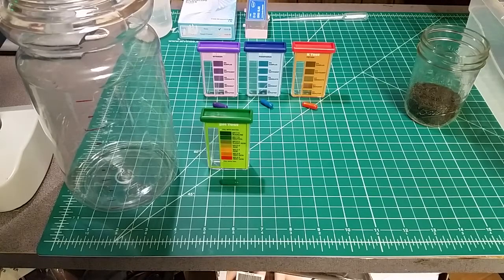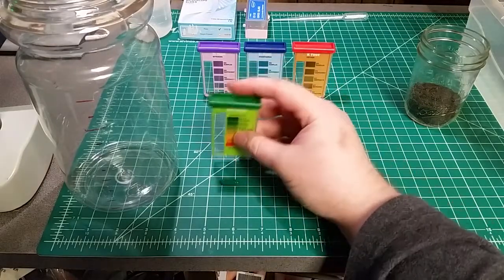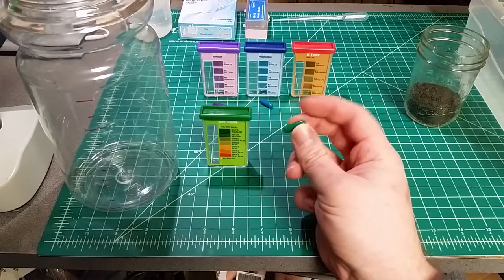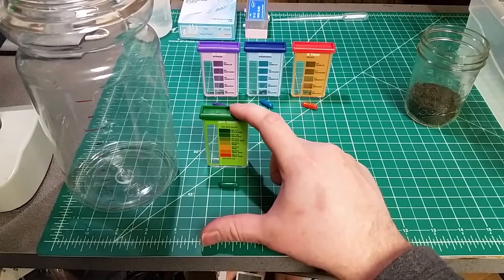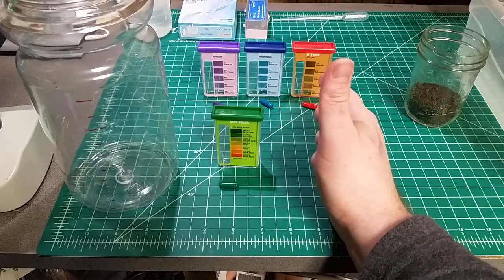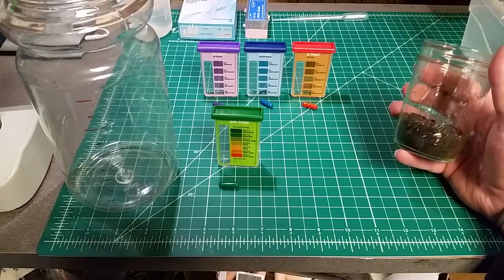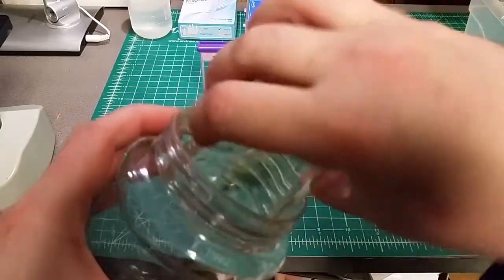We've got our individual testing vials, each with their color chart built into the front. The pH test is the quickest — we just dump in the prescribed amount of dirt and water to the fill lines, add the chemical, and shake. The other three tests for NPK are where we need to take only the water-soluble portion of the soil. I've measured out a little bit less than they recommend, but we'll have enough. We've got 50 milliliters of soil and we're going to mix this in a five-to-one ratio with water.